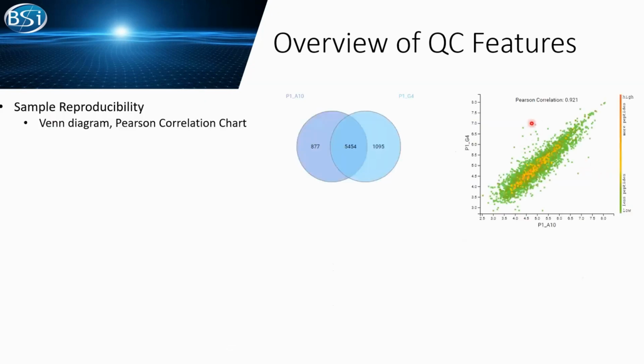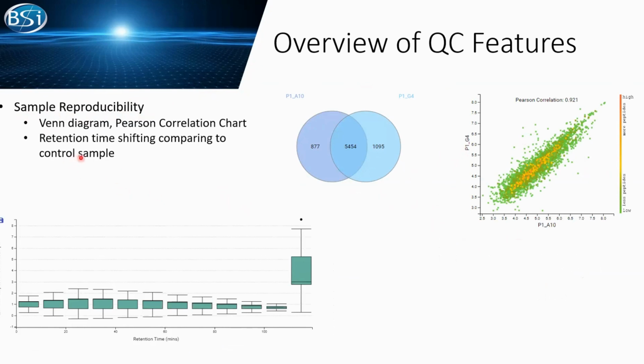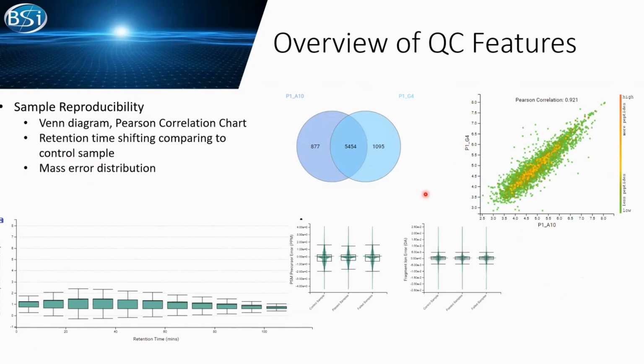Not only can we do variation, we can also check the sample reproducibility. We provide the Venn diagram to see what kind of overlap there is between the samples, the Pearson correlation chart, your quantification relationship between any two samples. Plus, we also give out the retention time shifting box plot here to tell you how your LC behaves. The mass spec error violin chart, and if you are doing quantification, a CV chart is also shown to help you see the variation between your quantification.